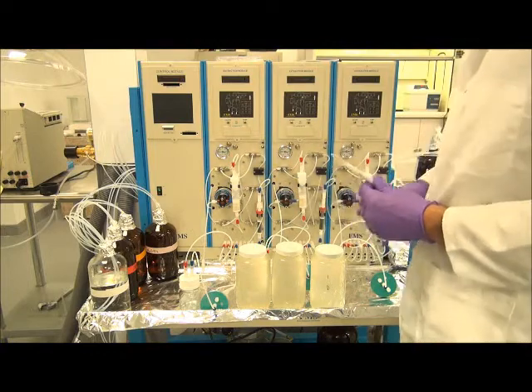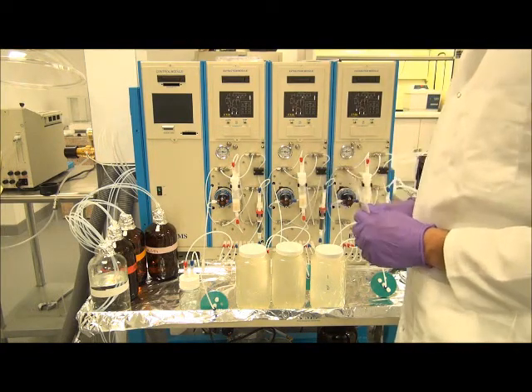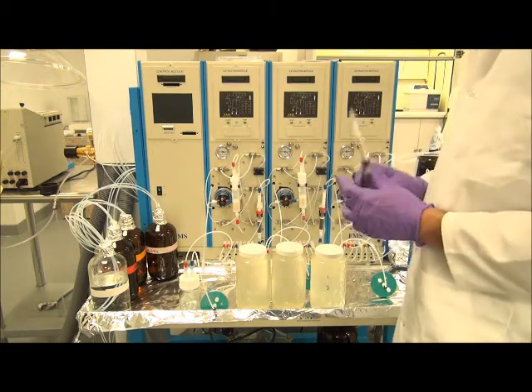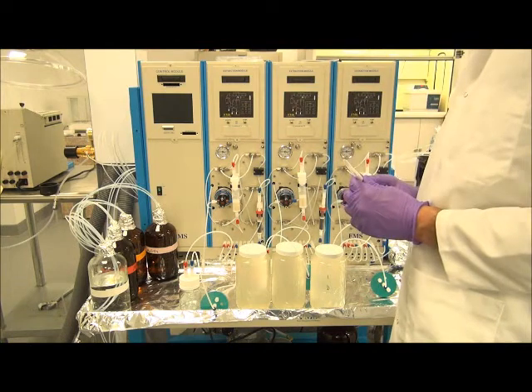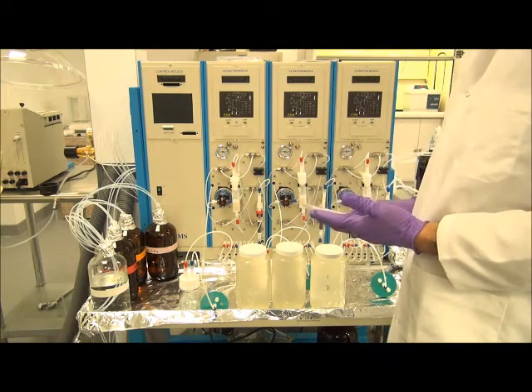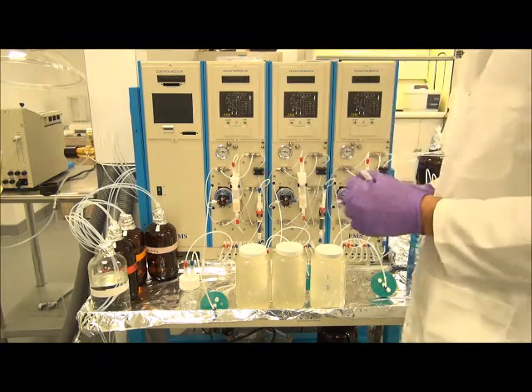The first cartridge is a reverse phase ion exchange bed packing. The second cartridge is a 2-gram coconut charcoal cartridge. This will automate the EPA process of extracting samples at both acidic and basic pHs while loading the sample across the cartridge in one pass.